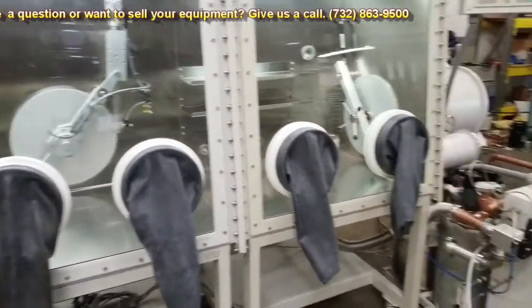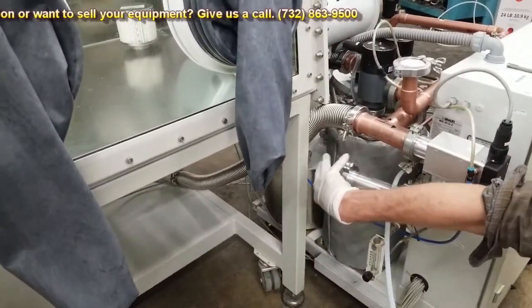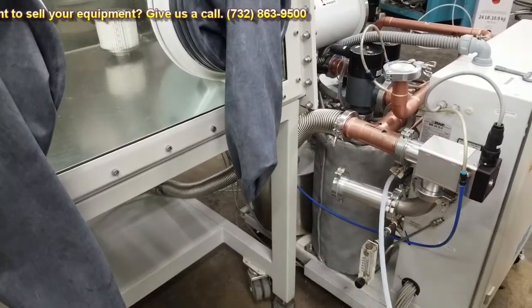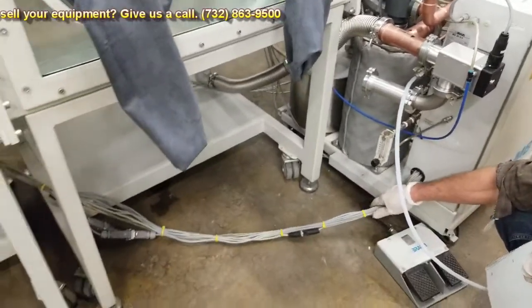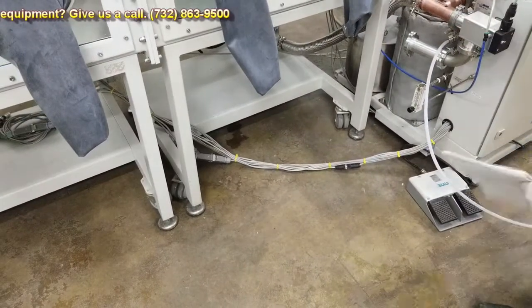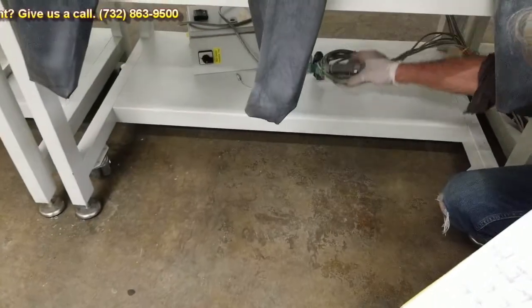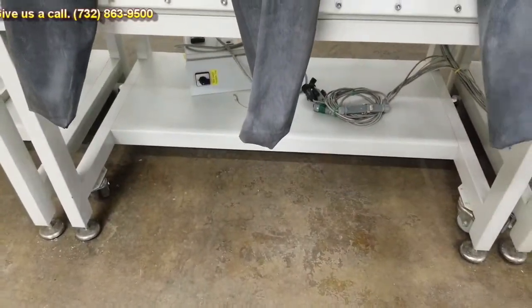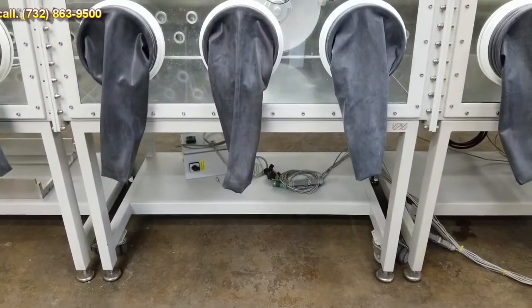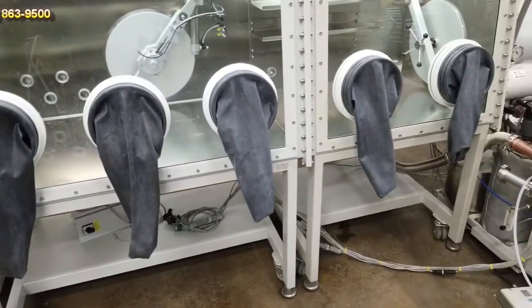Just to point out here, this is your purge line for when you do a box purge. So you may have to connect some kind of exhaust line up to your exhaust. And then this in yellow is all the cabling that's used for our air manifold in the back top of the door. And I tied off the cabling in green, and that would be to control your valving if you did have an antechamber number 2, such as your evacuation valve and your pump out valve and the sensors they use on it. Since there is no antechamber 2, I just left it over there.